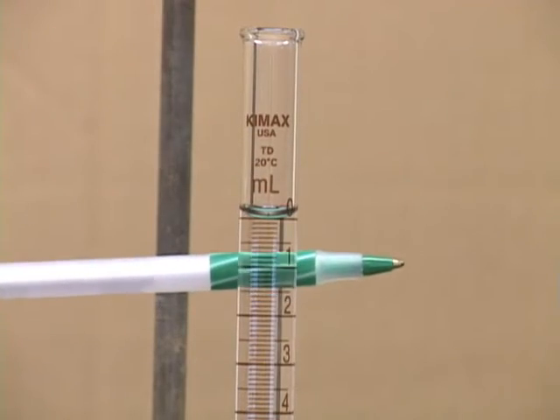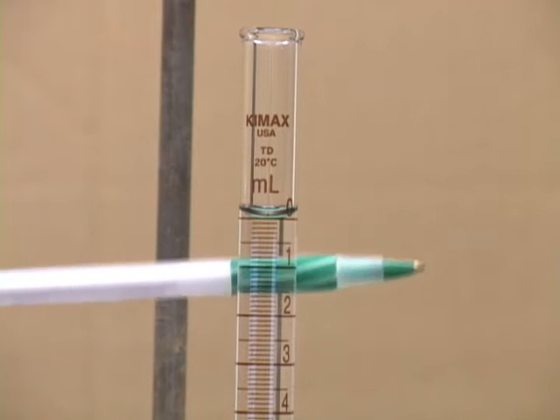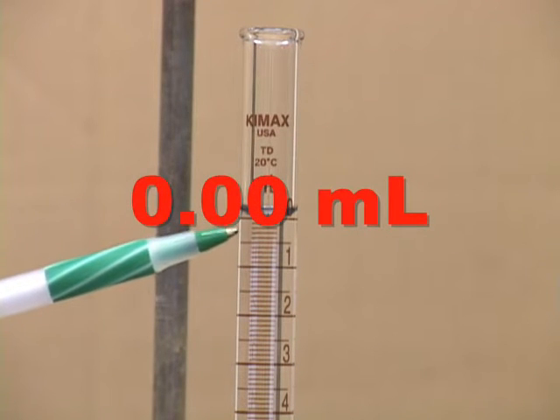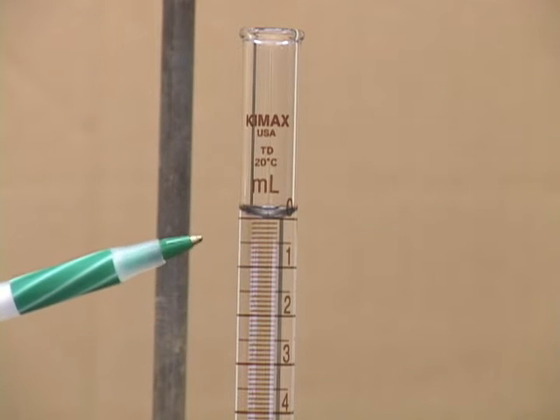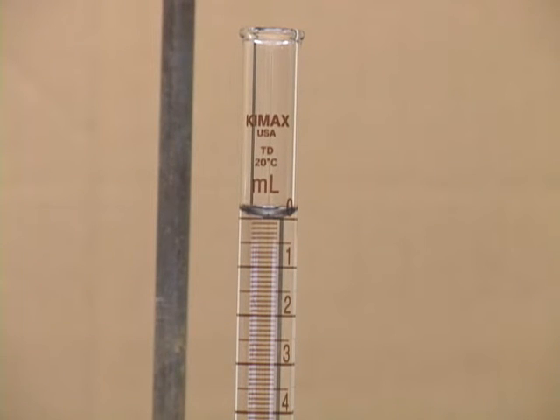The bottom of the meniscus, you see, is affected by the background color here. The other thing you should note is that there is no parallax error, because the major lines like the 0 and the 1 line here are circles, and you can only see them here as straight lines, which means that you're looking at them with no parallax error.